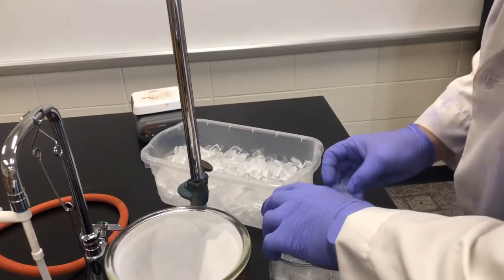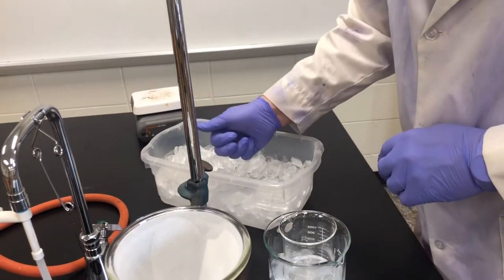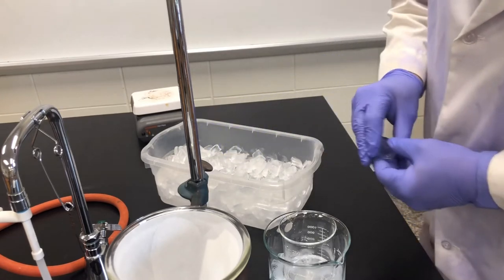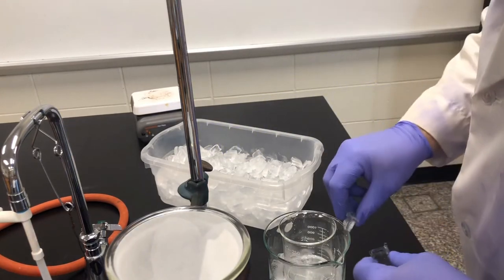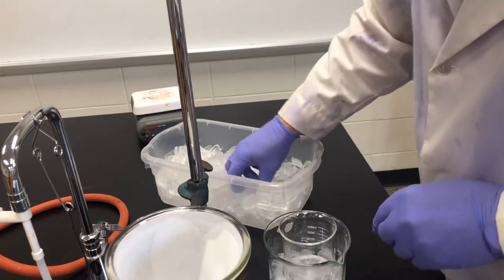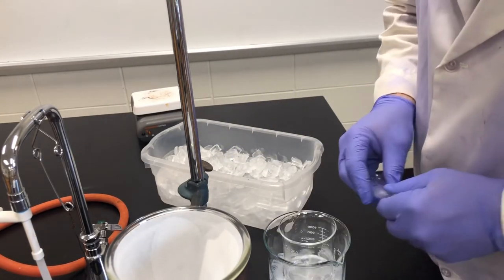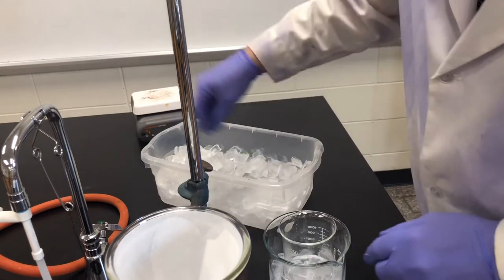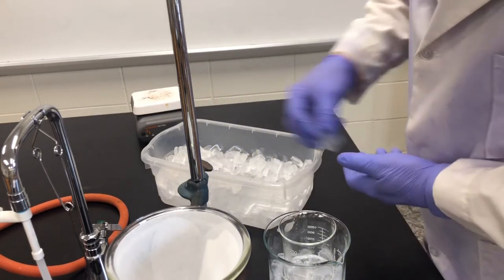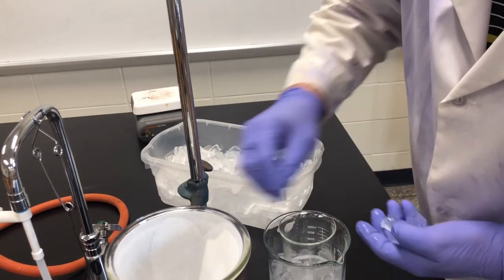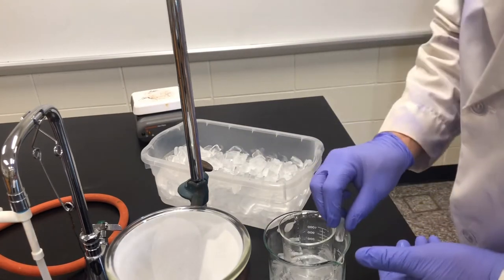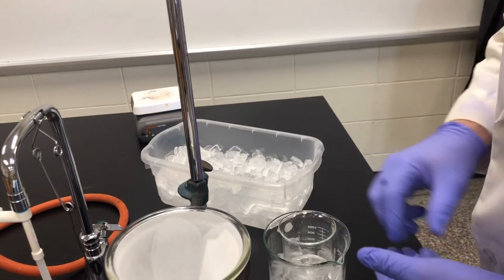We would put the ice around it making sure it does not go into the beaker. That does cause some problems because as you increase the amount of water, the solubility stays the same but the amount of water can dissolve more, so you don't want to increase the water.